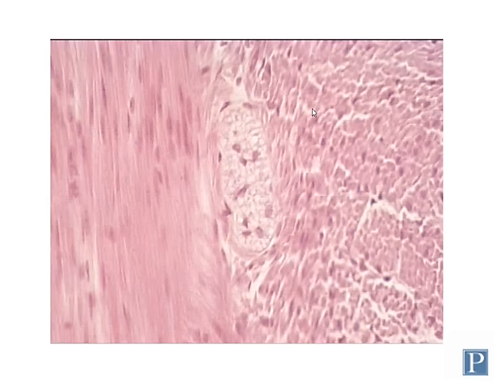Here's another one up here and part of another one. Normally, though, in tissue, smooth muscle is going to look something like this. Most smooth muscle is organized into sheets. You can see nuclei of many of these smooth muscle cells, but trying to actually distinguish individual smooth muscle cells from others is a little bit tricky, although if you look at their nuclei, you can count them. They typically have a single nucleus in the middle of the cell.